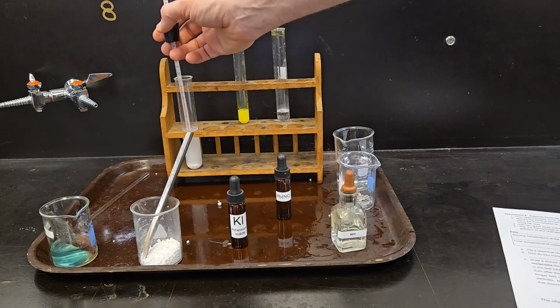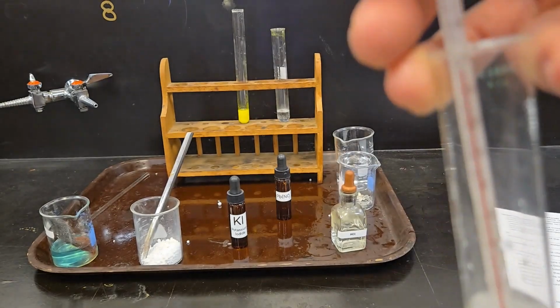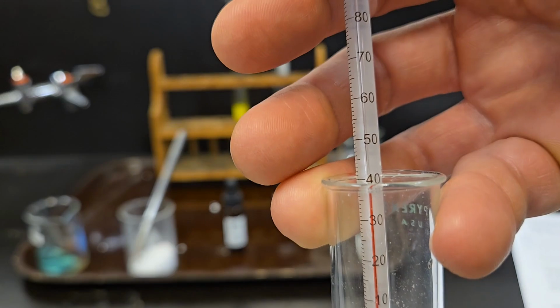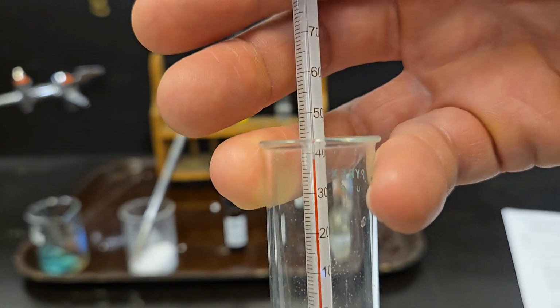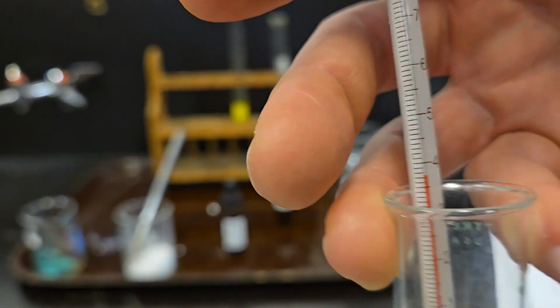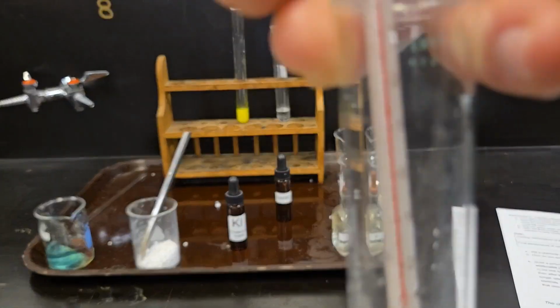Now, the directions say to give the calcium chloride and water mixture a stir with the thermometer, and then read our thermometer, see if there was a reaction. You can see the red line of our thermometer going up, up, up. It's already at about 39 degrees. If I give this another little shake, might be able to get it to go up a little farther.